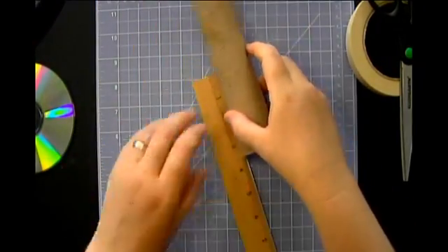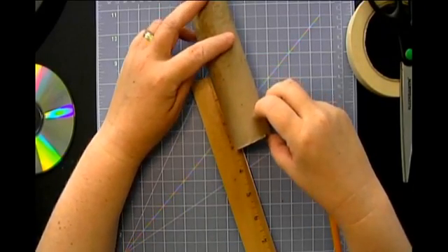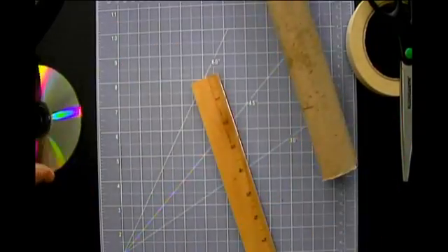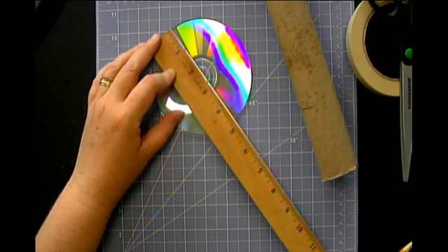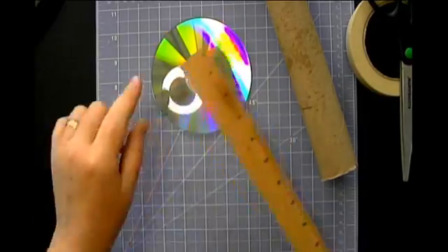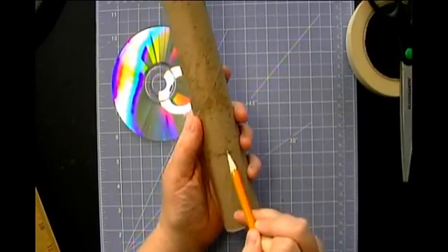Ideally, we just want to create a slit on the back a couple inches up from the bottom. So I'm going to go 3 inches. I'm just going to mark my tube. I'm doing 3 inches because our CD, if you can see that, is about 5 inches across. So I want something that's a little bit more than halfway because we don't want our CD to pop out the bottom. Okay? So I've marked my 3 inches here.